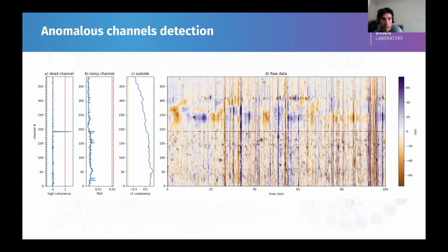The second part is to detect the bad channels. Here, as we can see, this is a raw recording on the right, and to detect the bad channels, we have three metrics that we apply. We try to detect the dead channels, the noisy channels, and the channels that are outside of the brain. Here I've taken the example of the dataset that we've provided for the assignments. In this case, there is only one channel that is seen as noisy: the reference channel, channel 191 for the Neuropixels probe. Having this display is interesting because you can see which metric is failing for the bad channel, and you can adjust the threshold if you think it's necessary.